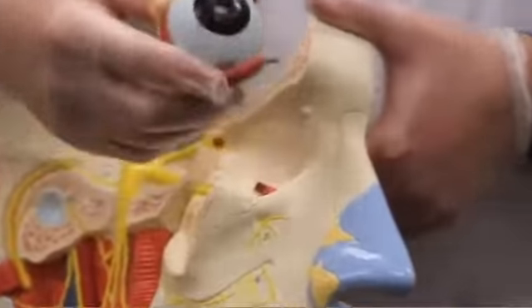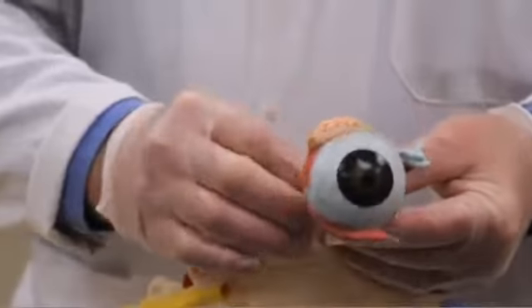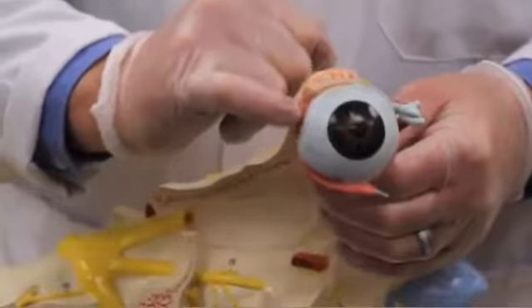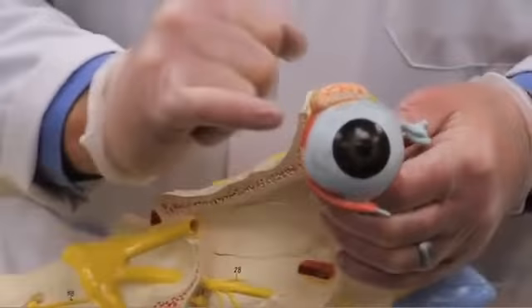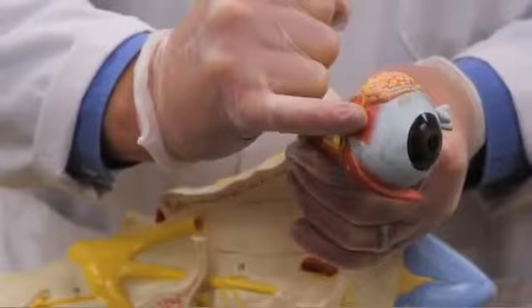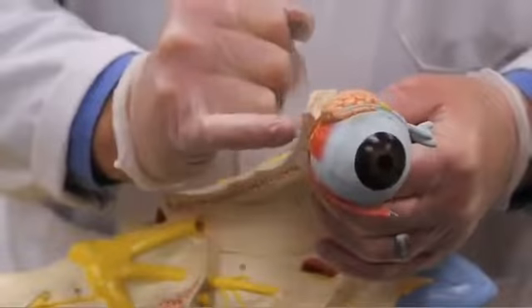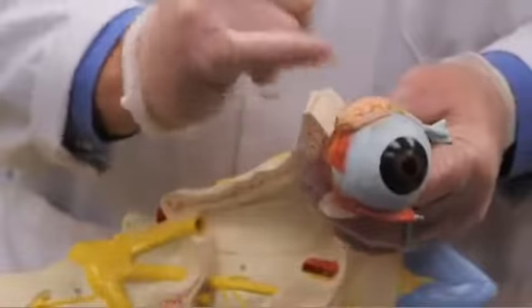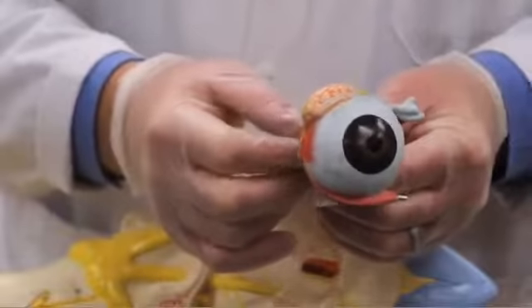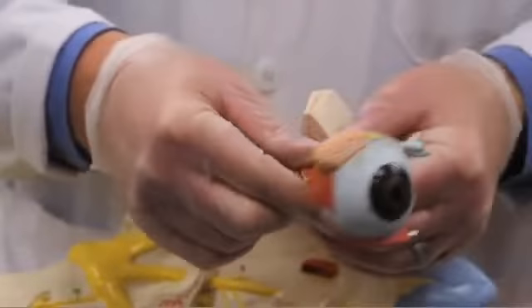If we remove this structure and look at the eye a little closer, you can see that all around the outside of the eye, about halfway moving posterior towards the optic nerve in the back, you have muscles that come straight into the side portion of the eye, the top, the bottom, and medial part. Those structures are referred to as the superior, lateral, medial, and inferior rectus muscles. Each of their shortening would cause lifting and movement inward or out of the eye.